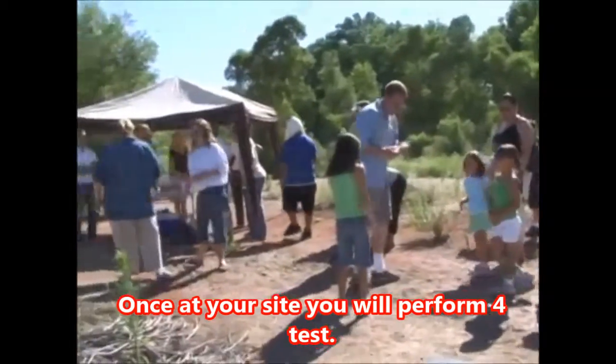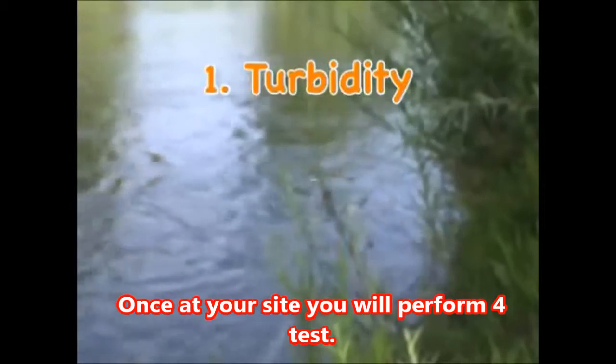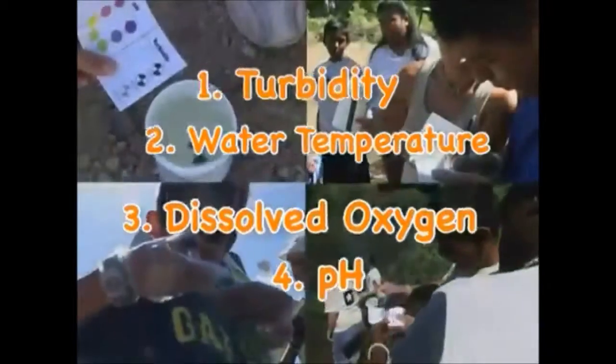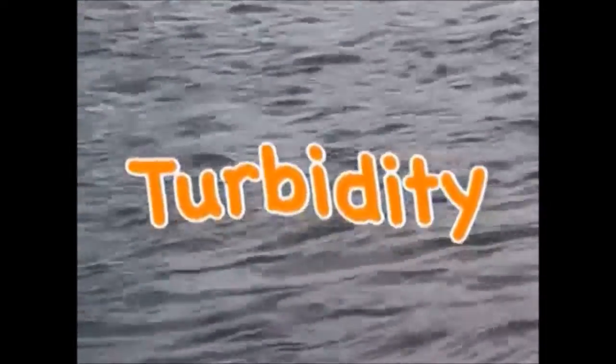Once at your site, you will perform tests for 4 basic water quality parameters: turbidity, water temperature, dissolved oxygen, and pH. We'll explain each parameter along with the steps for conducting each test. The first test determines the turbidity or clarity of the water.